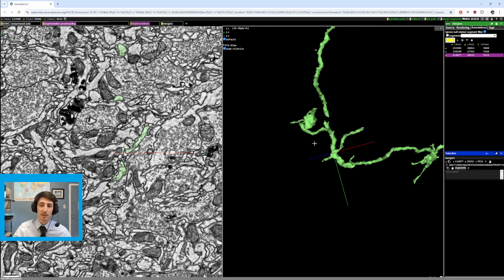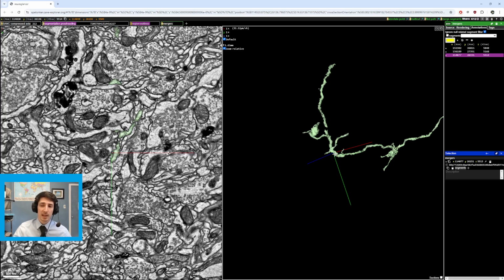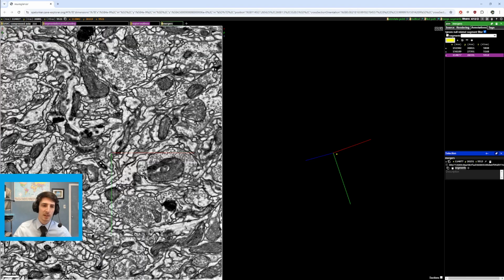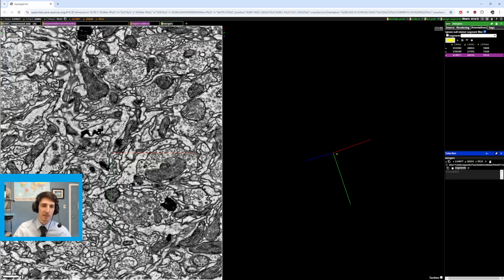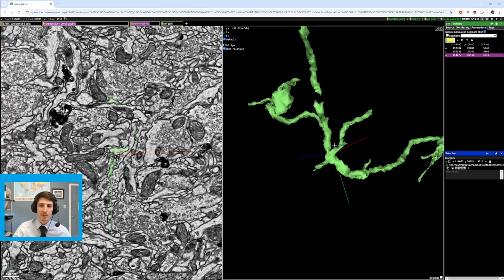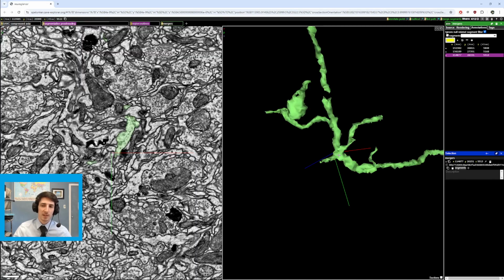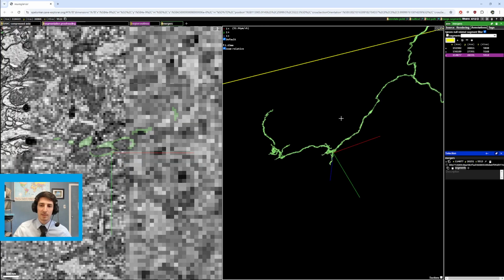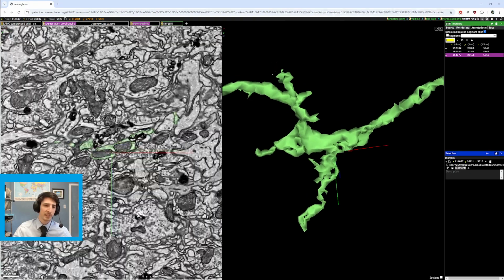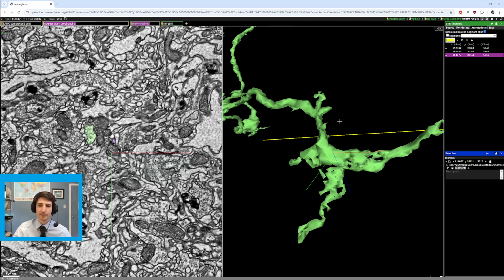So keep your eye out for perpendicular things. So we tried to rule this out, but when we took a better look, looks like some goes that way, and this main branch goes this way. But this area here, you could see that there is a merger. So keep in mind, when you see stuff like this coming off, a lot of times, in this case as well, this is also a merger.